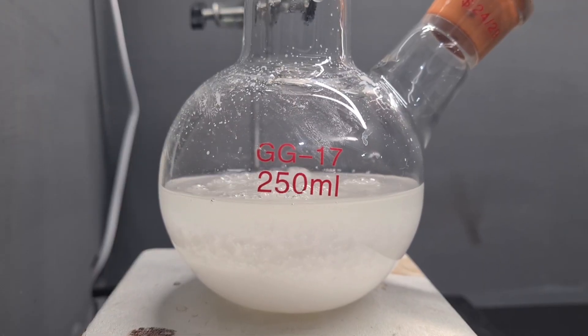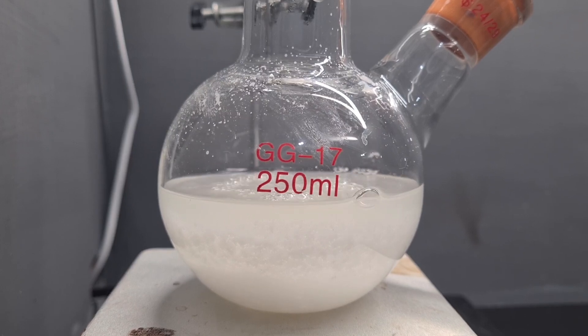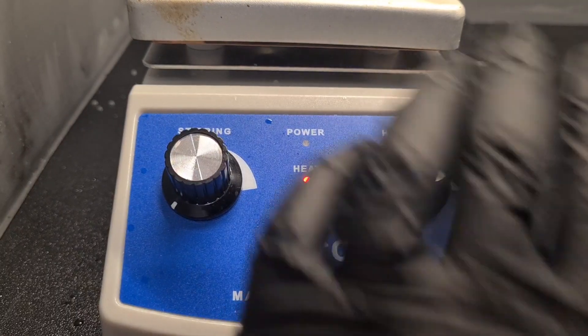Now as the reaction comes to a finish, you can see the bubbles of ammonia gas die down. Now I'm going to turn off the heating.